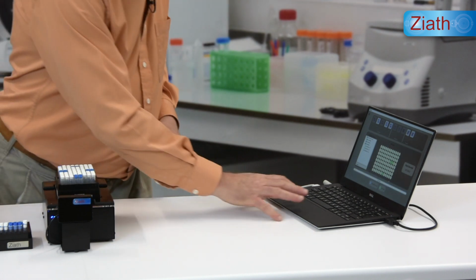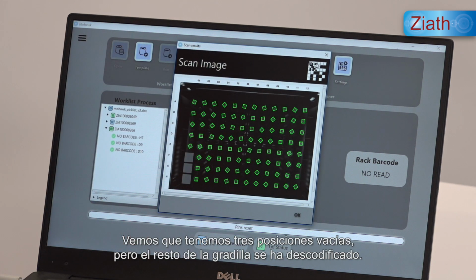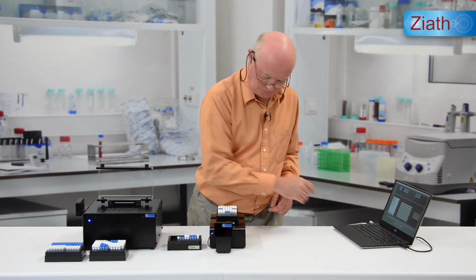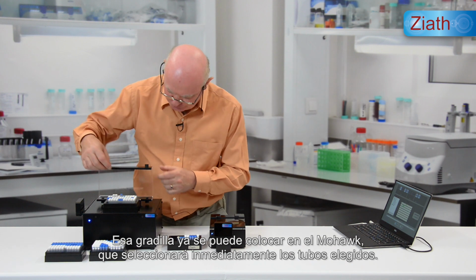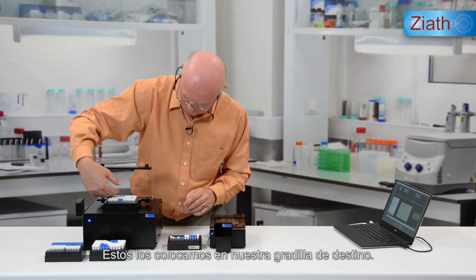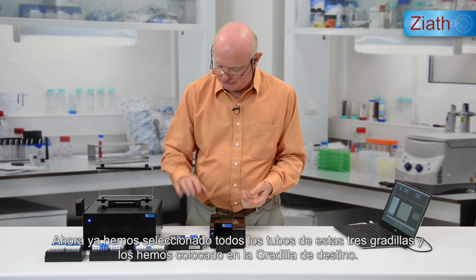Placed on the scanner. Again, tube IDs are verified. We see we have 3 empty positions, but the whole of the rest of the rack has been decoded. That rack goes to the Mohawk. It immediately picks the selected tubes, which go into our destination rack. So now we've selected all of the tubes from these 3 racks and placed them in a destination rack.